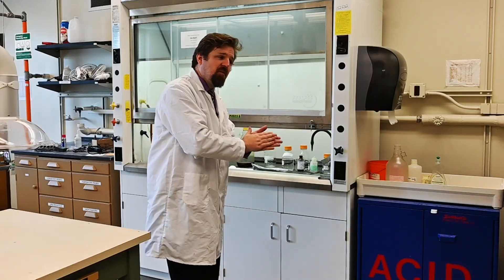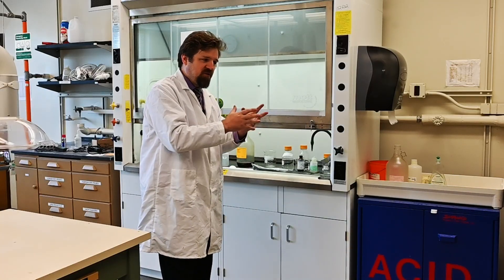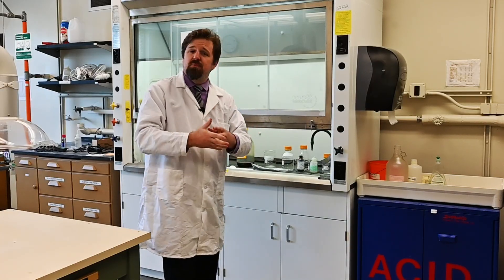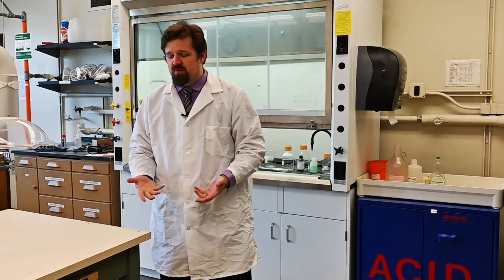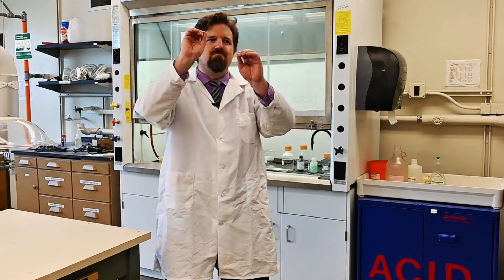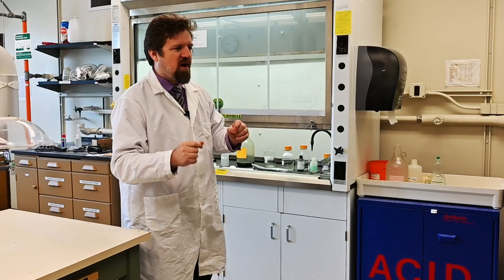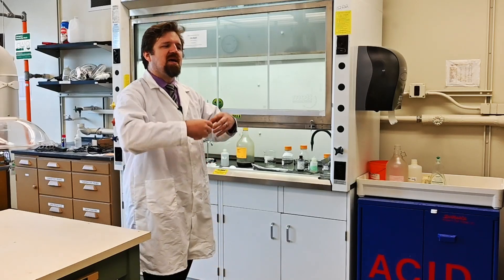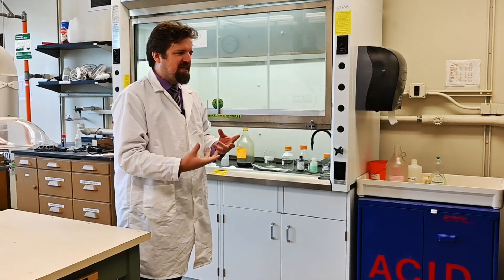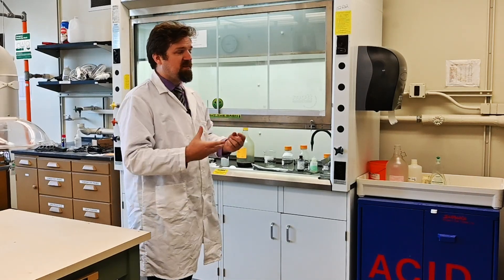But some volatile liquids are not dangerous — like perfumes. Perfumes are volatile. So don't misinterpret what the word volatile actually means. Volatile just means it evaporates easily, and in the chemistry lab, that usually means it's dangerous.